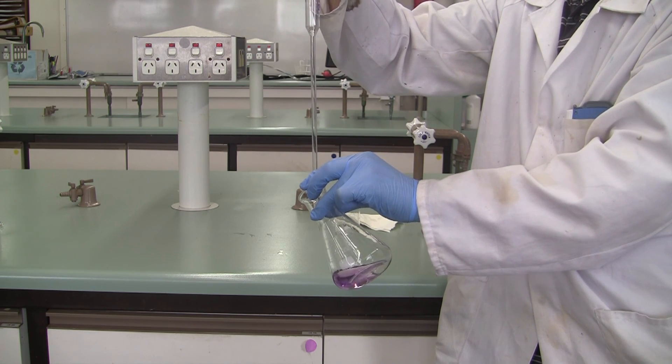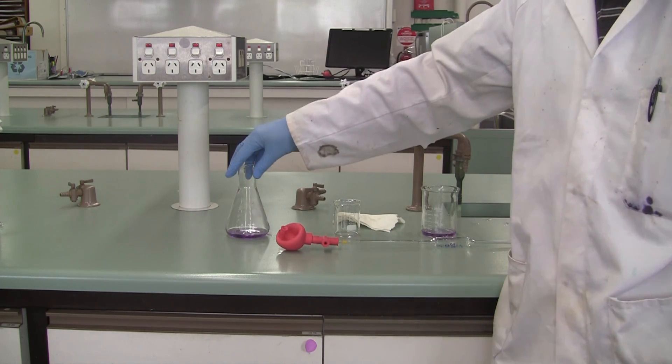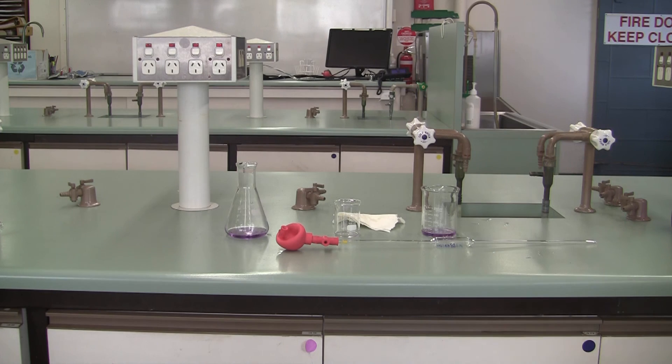If you get into all of these good habits, you'll be able to deliver an accurate and precise aliquot from your pipette anytime that you like. Good luck.